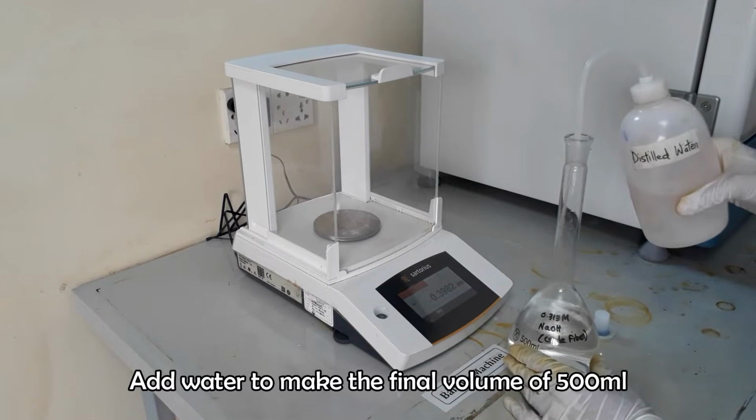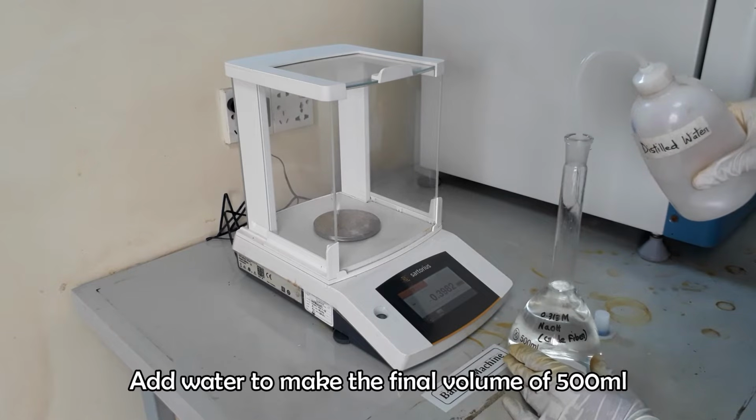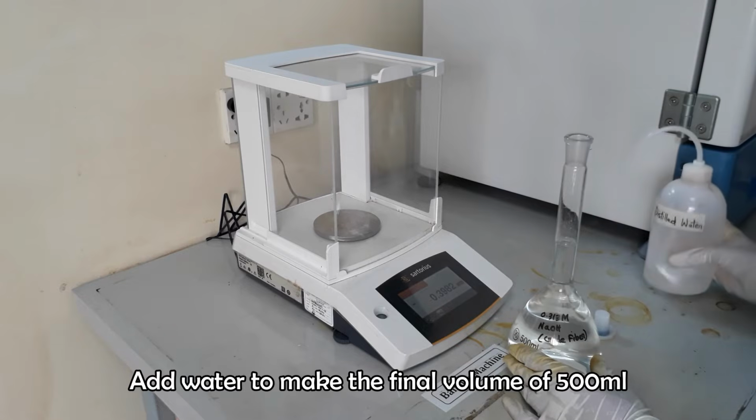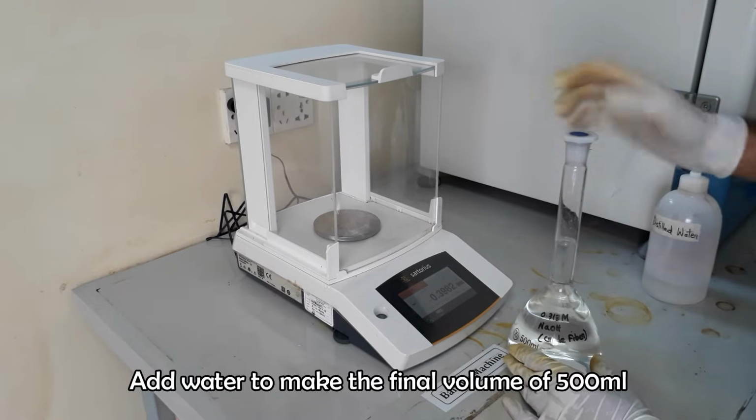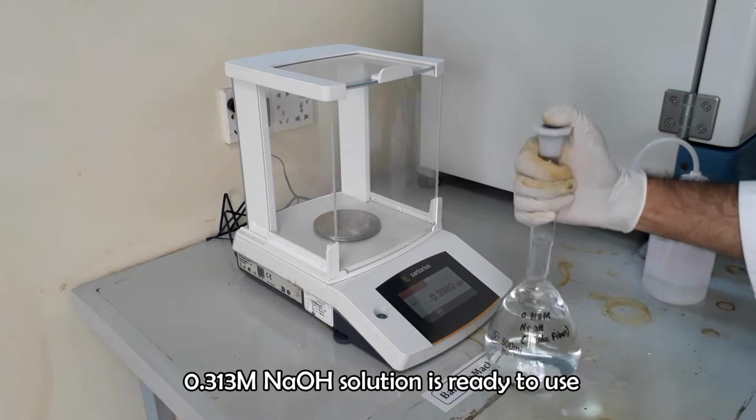Finally, fill the flask with water up to the mark to make the final volume of 500 milliliters. Now we are ready to do the fiber analysis.